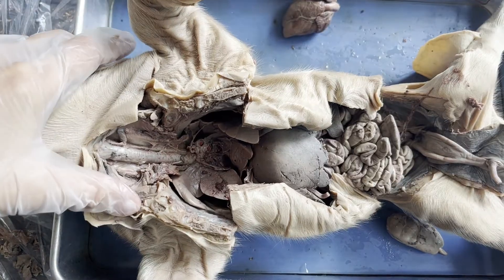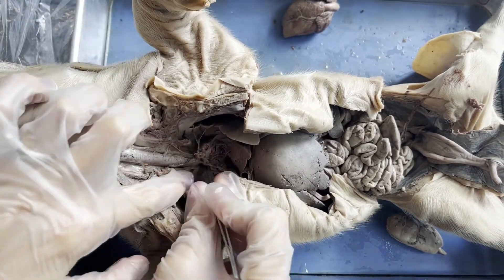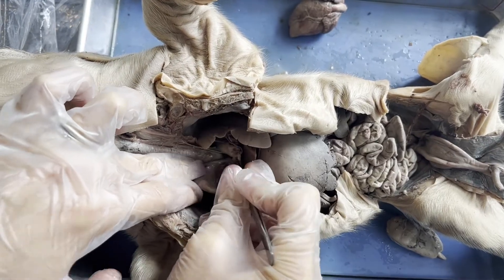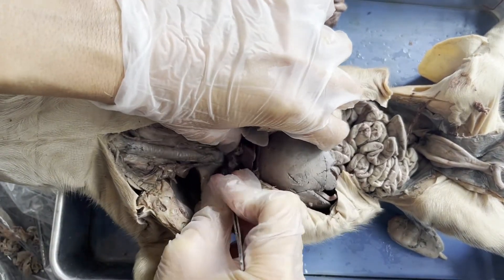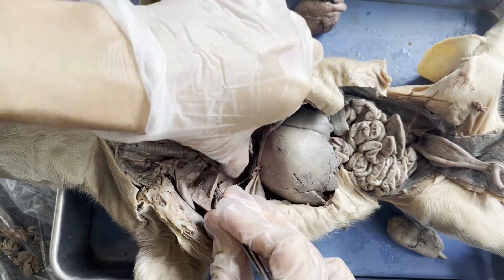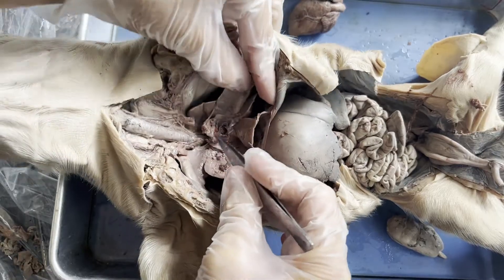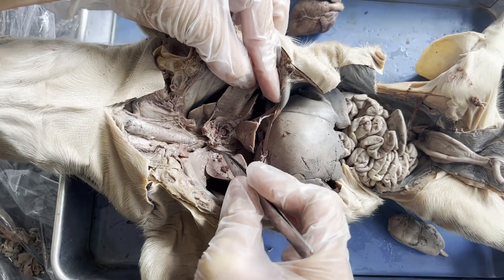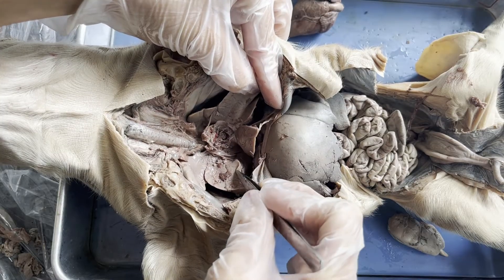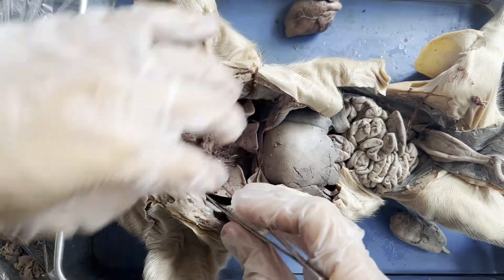It's very difficult to see where the trachea splits, but the trachea will split into two bronchi — a right bronchi and a left bronchi. The right bronchi leads to the right lung, and the left bronchi leads to the left lung. Just like the liver, the lungs in our fetal pig have lobes to them.